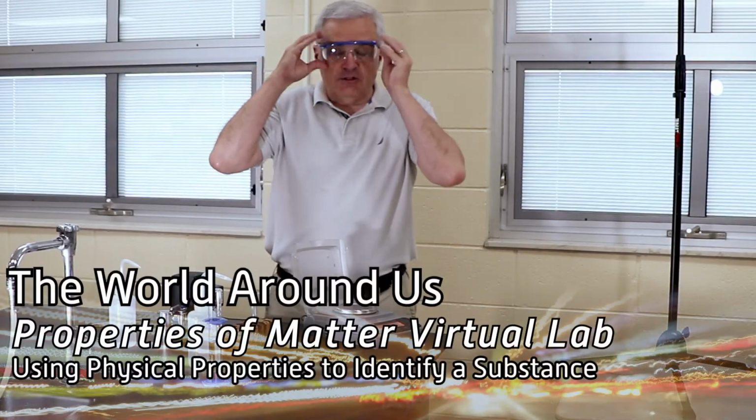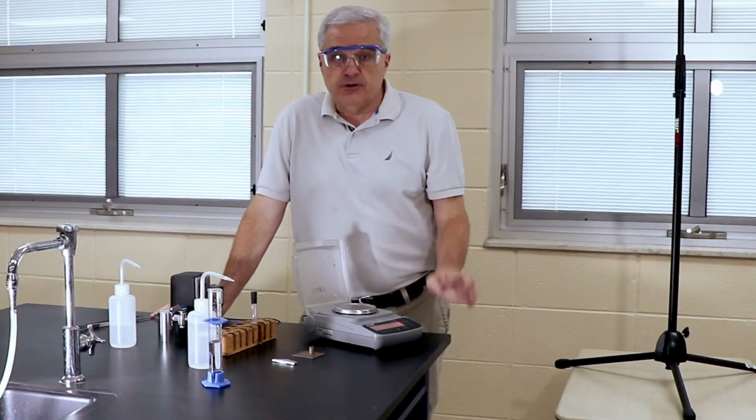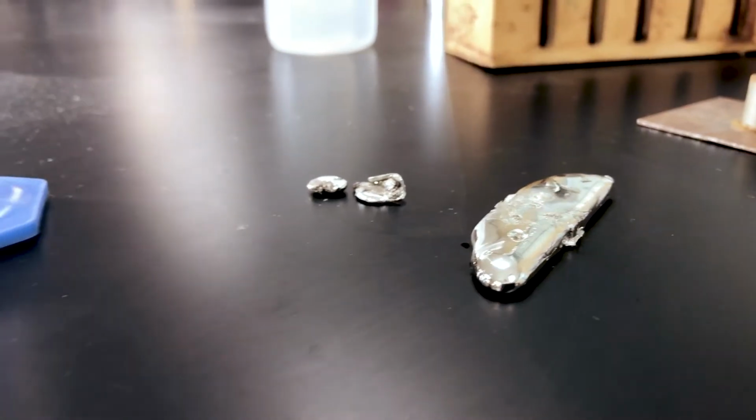I'm Bill Snodgrass, and in this World Around Us video, we're going to do a virtual lab. We're going to use the physical properties of a substance to try to determine what that substance is.